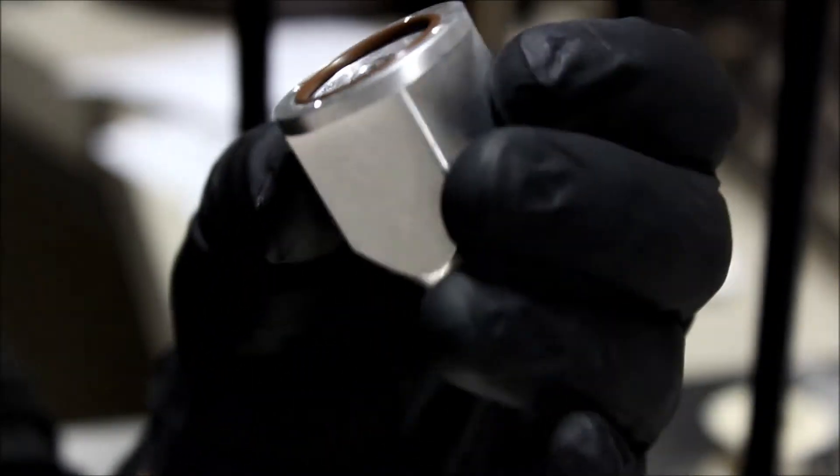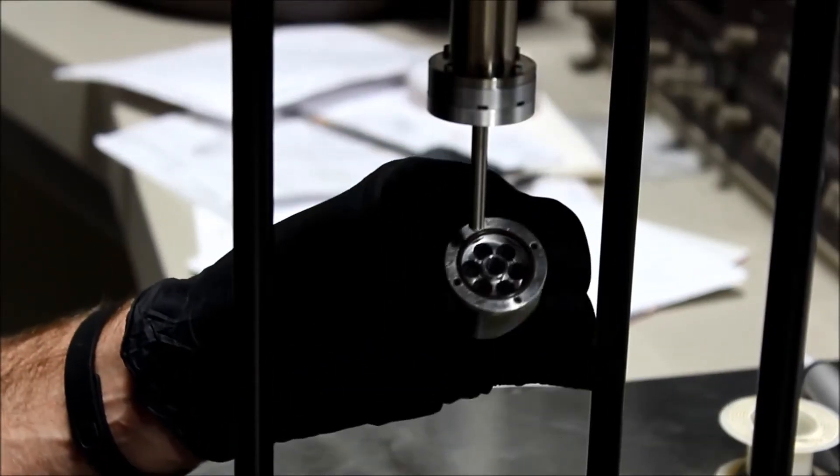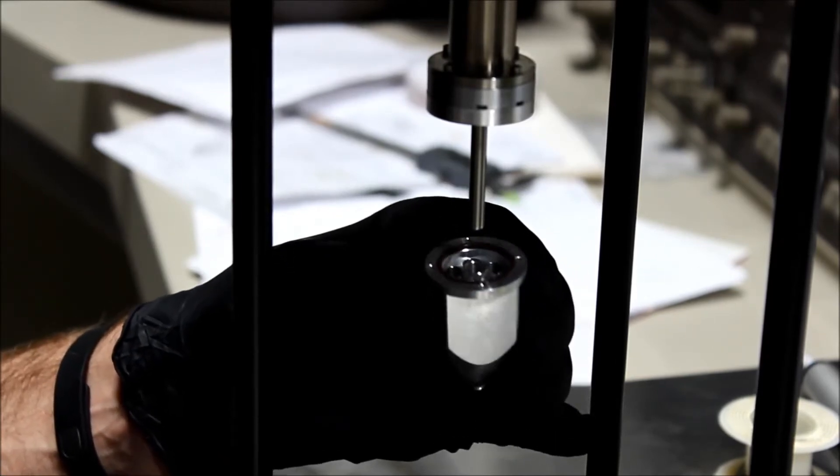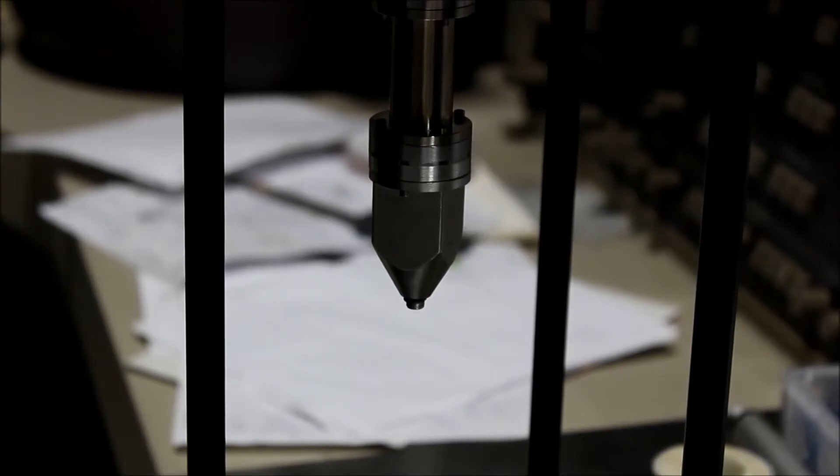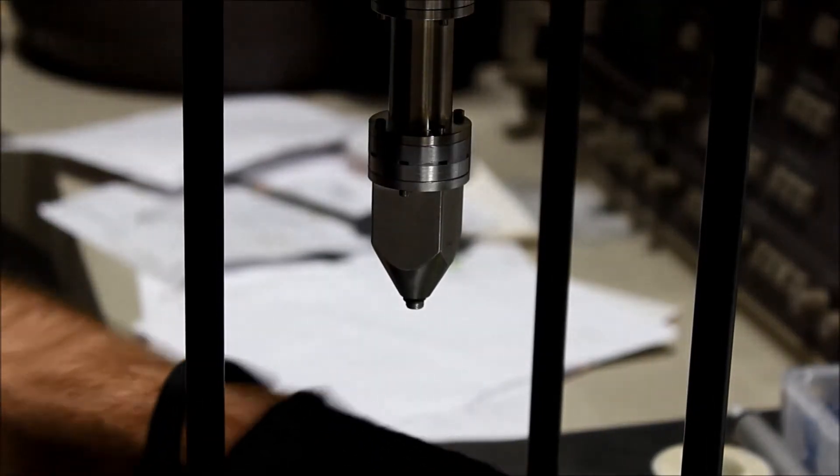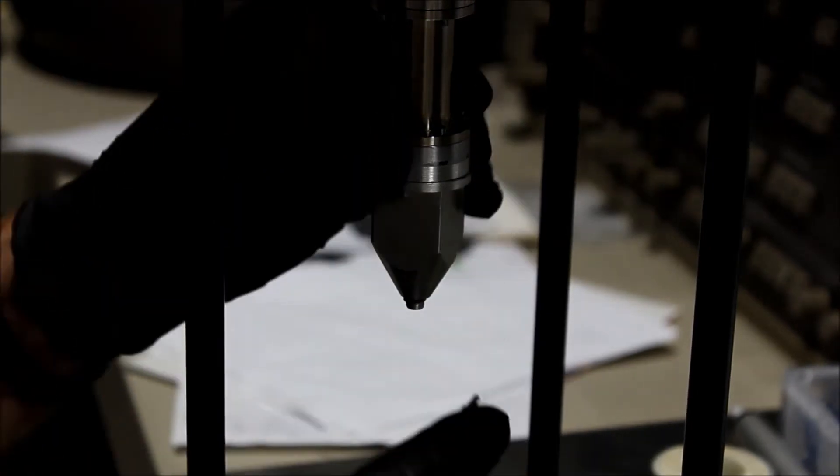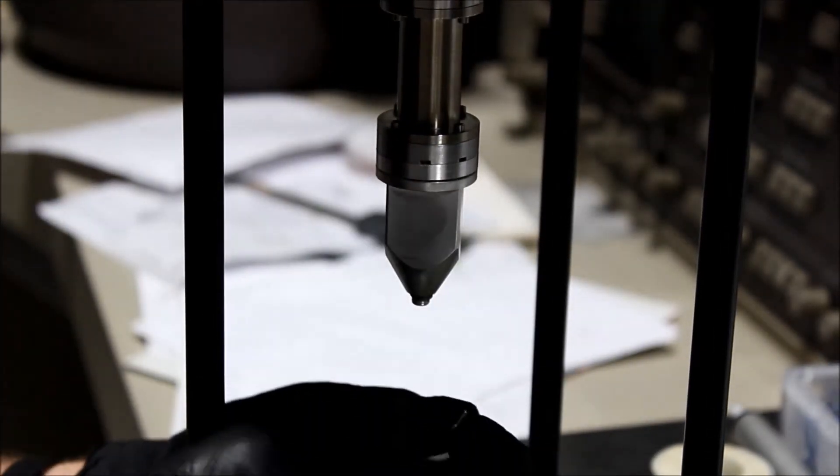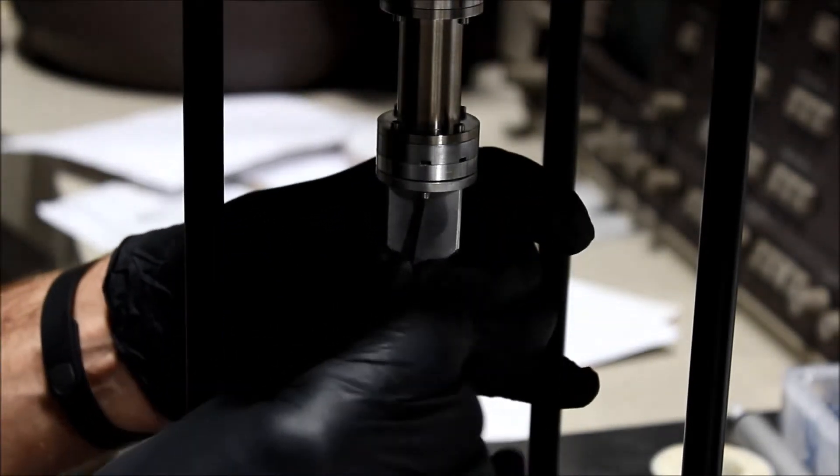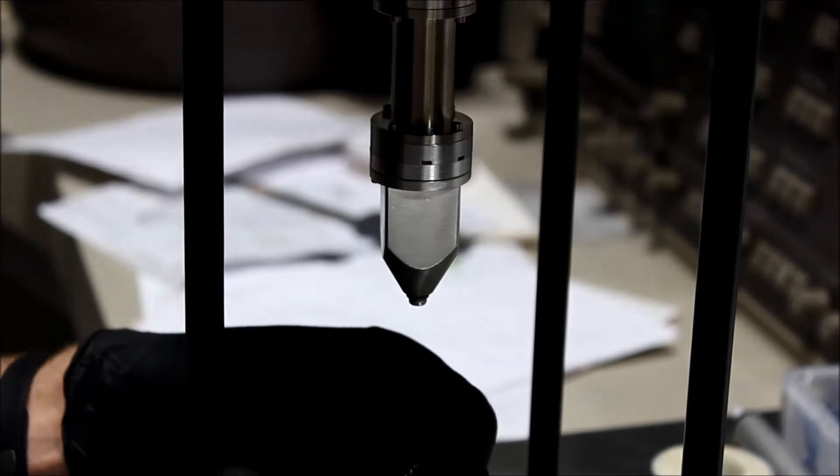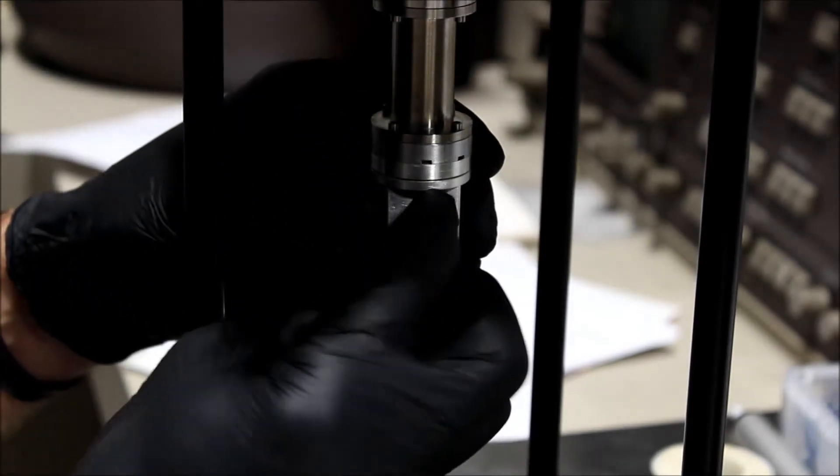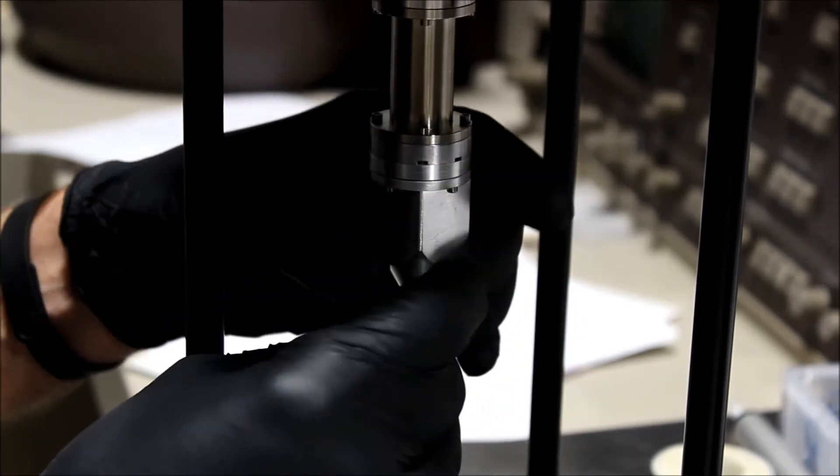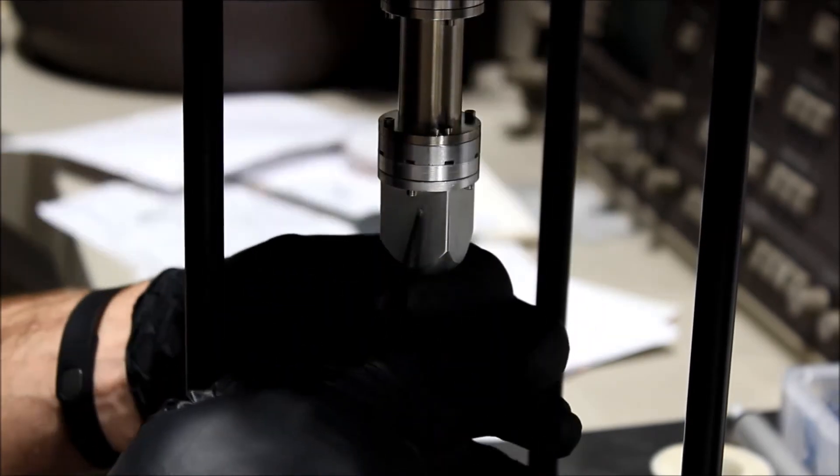That's the basic assembly of the crucible. Now if you go ahead and refill it, we can reassemble the crucible. I'll just place the crucible back on the plunger. We'll just install screws loose at first. Once all four are installed, then we'll tighten them. We'll just start by installing them very loose. That will ensure that the crucible is aligned nicely with the plunger rod. Okay, so now they're loose. Now I can begin tightening.